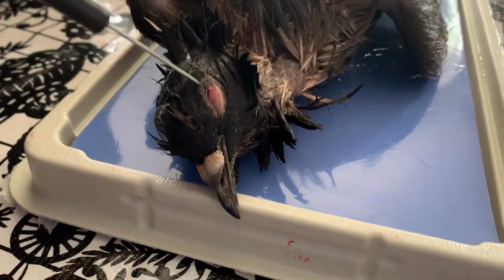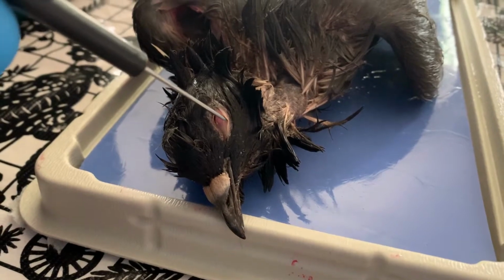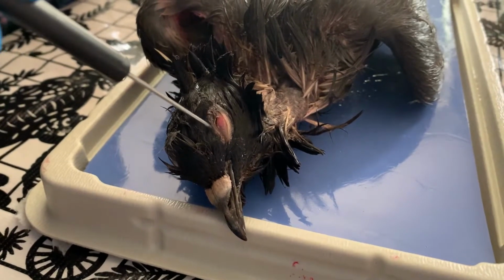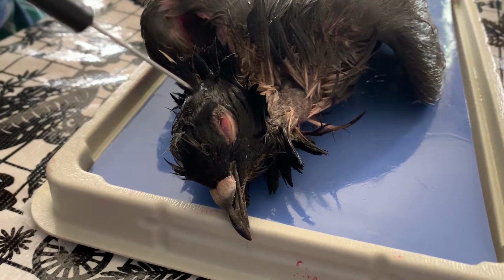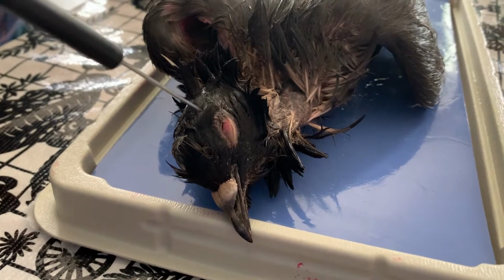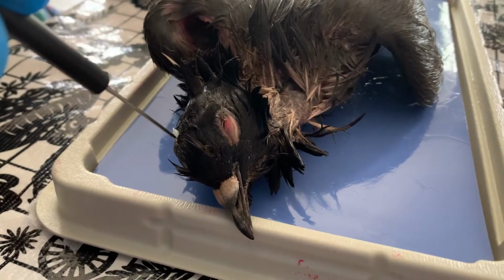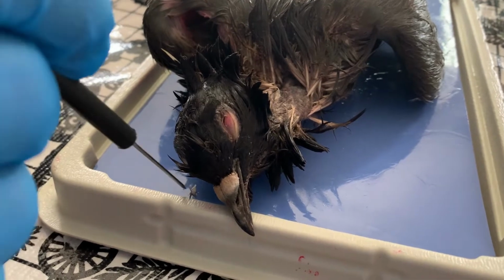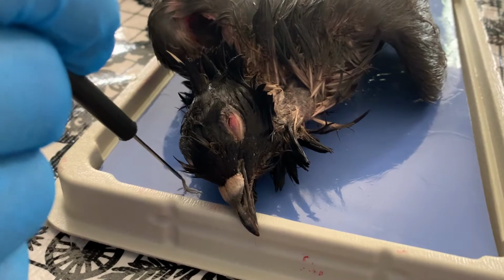The eyes. Each eye has both a lower and an upper eyelid. Beneath these is what's called the nictitating membrane, or the third eyelid. This membrane is used to brush tears across the eyeballs. Diving birds have clear nictitating membranes that are kind of contact lenses that extend all the way across the eye. This helps them to have clear vision while they're underwater.